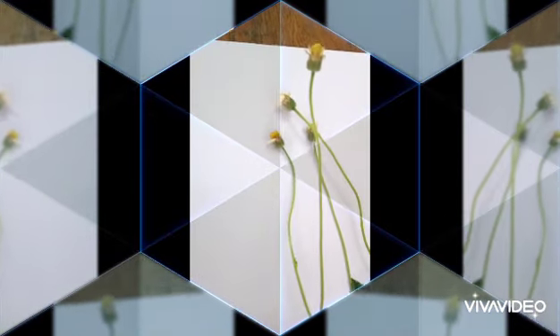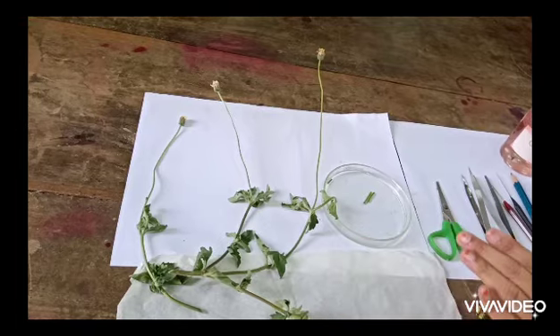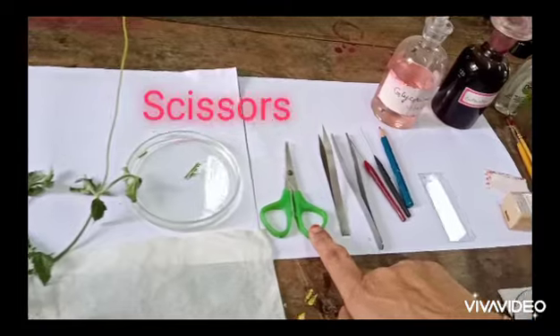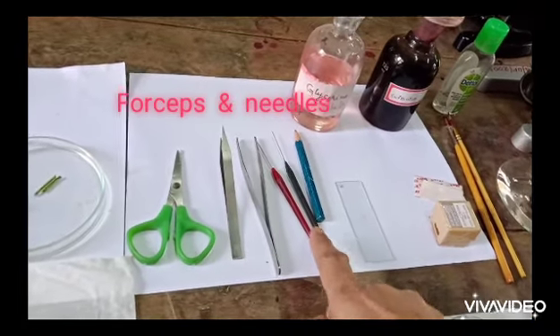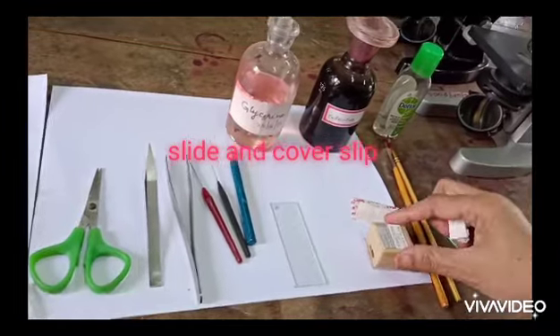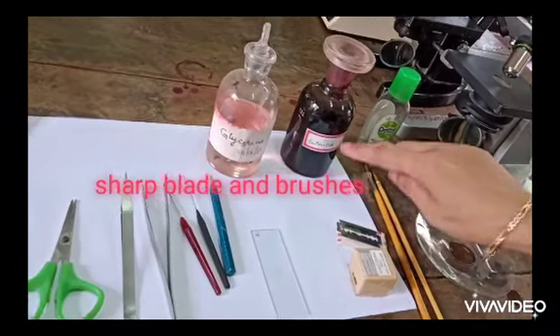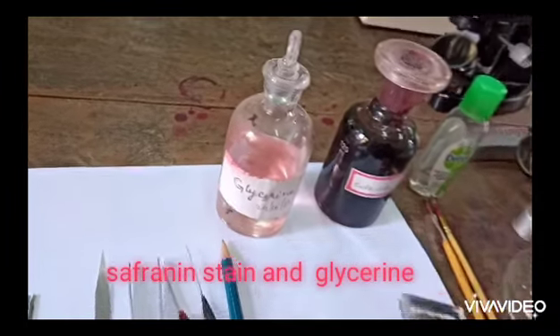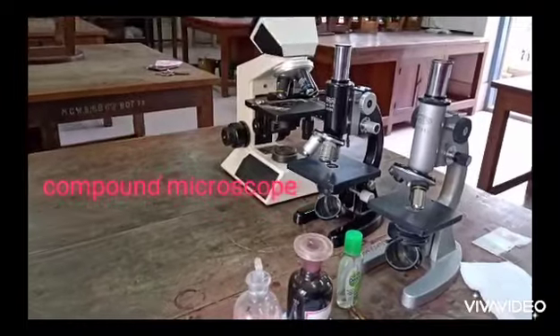Now moving on to the materials required. The materials required include the plant specimens, petri dish, scissor, forceps, needles, slide, cover slips, sharp blade, brushes, glycerin, safranin, and compound microscope.